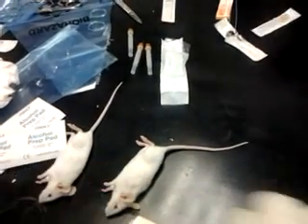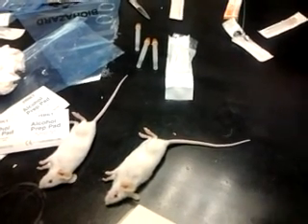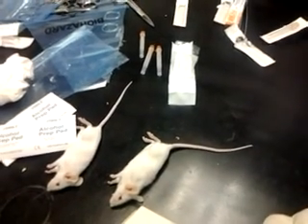So which one is currently used? Because there are two types. The one that you don't feel pain, but it takes longer to recover. Yes, but this is a short duration also, only 45 minutes if you give the precise dose. If you find that the animal doesn't sleep properly, you have to give another dose.